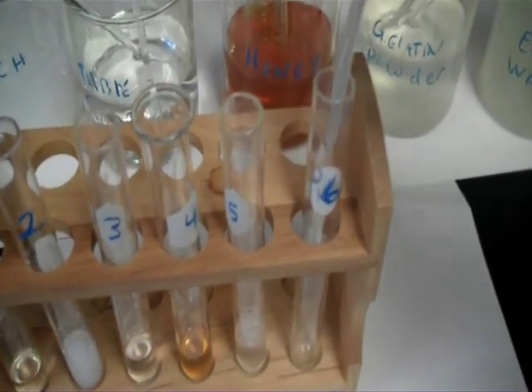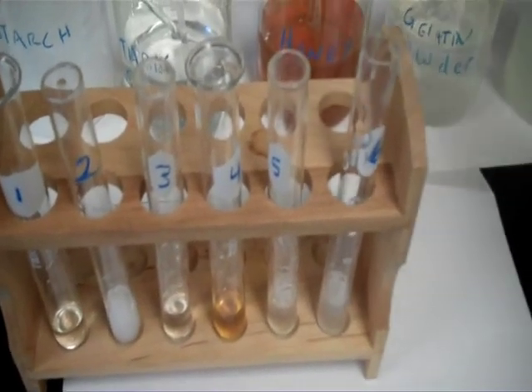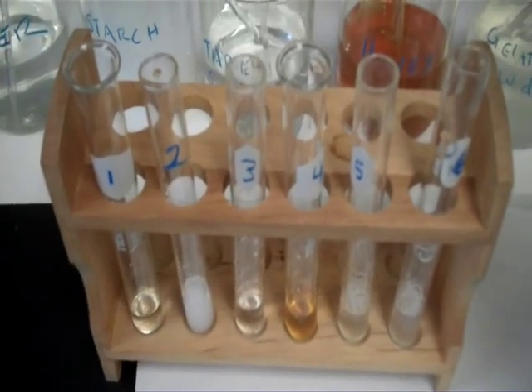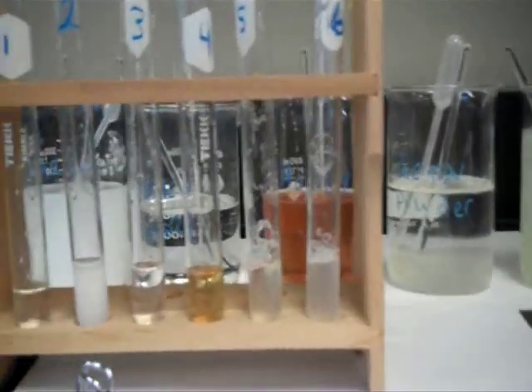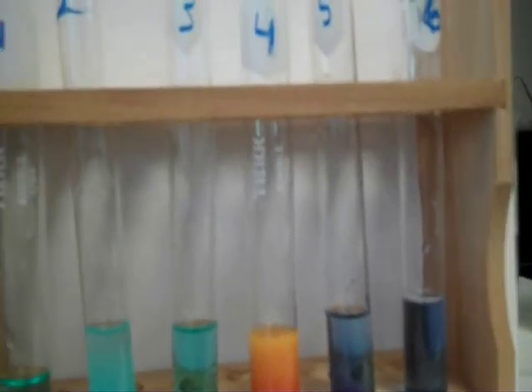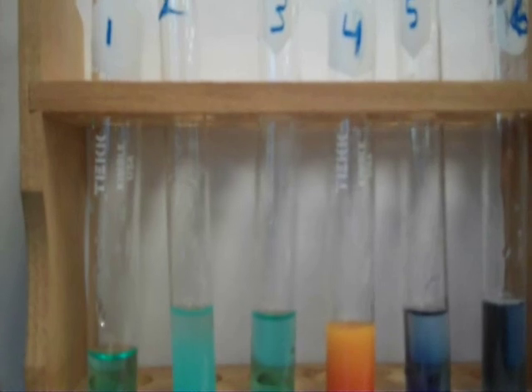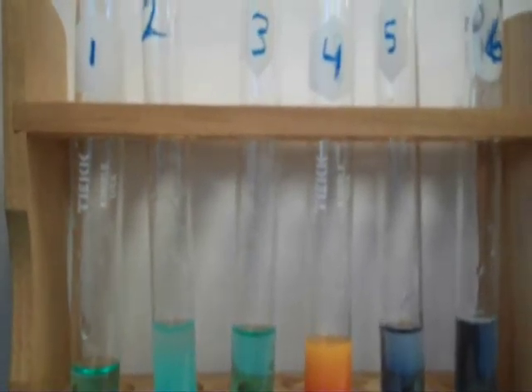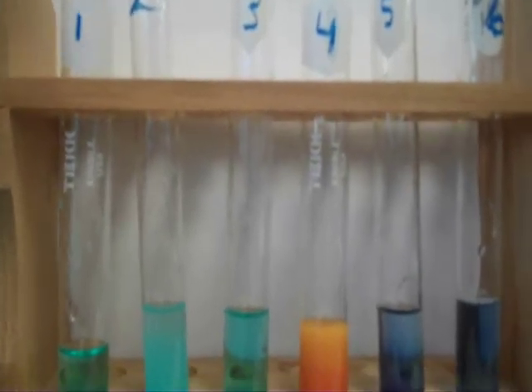Simple sugars like glucose, fructose, and galactose join together to make double sugars, and then in turn can join together to make polysaccharides of the complex carbohydrates. After adding the Benedict's solution and heating the test tubes for two minutes, we see the results. We're looking for a red, orange, or yellow color — that's a positive test for simple reducing sugars. Not all sugars are going to test positive, but simple reducing ones will.